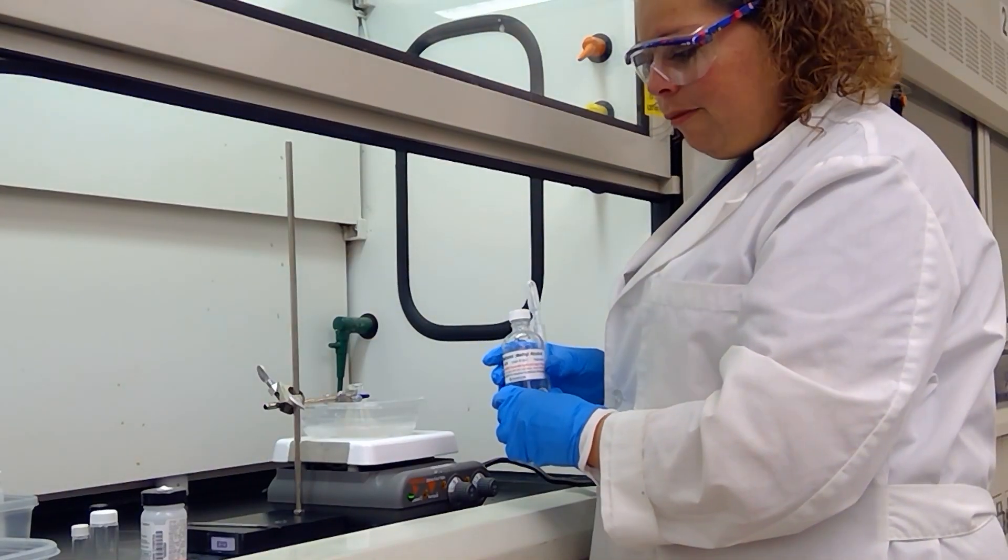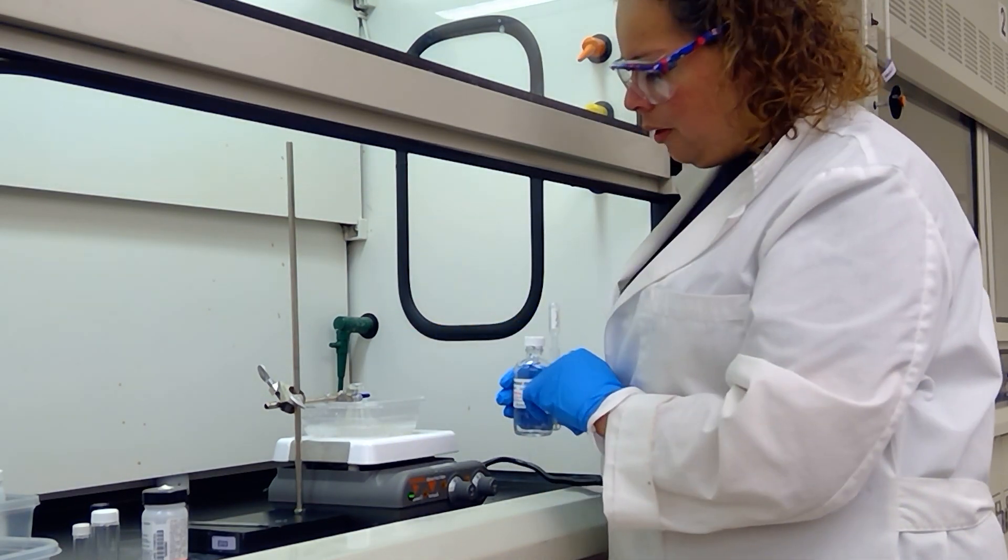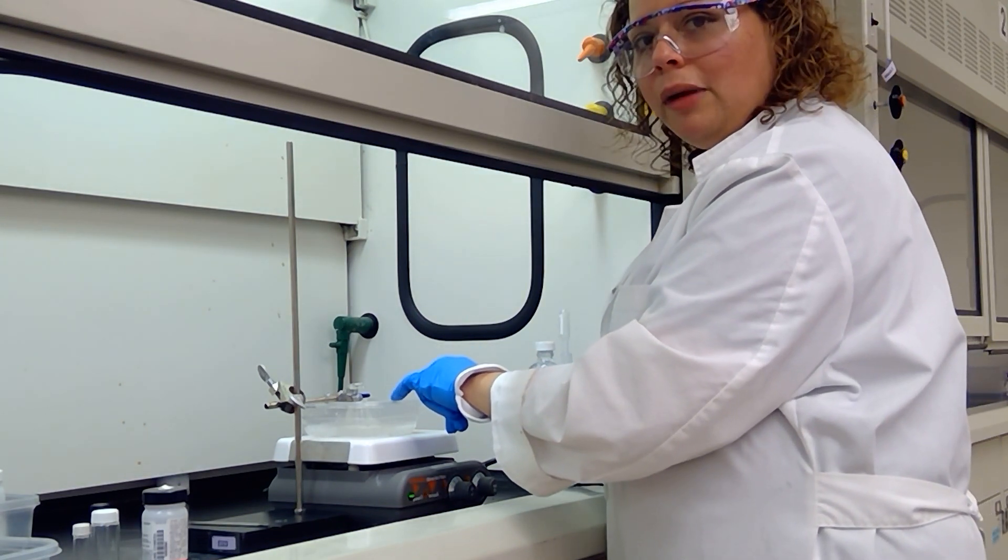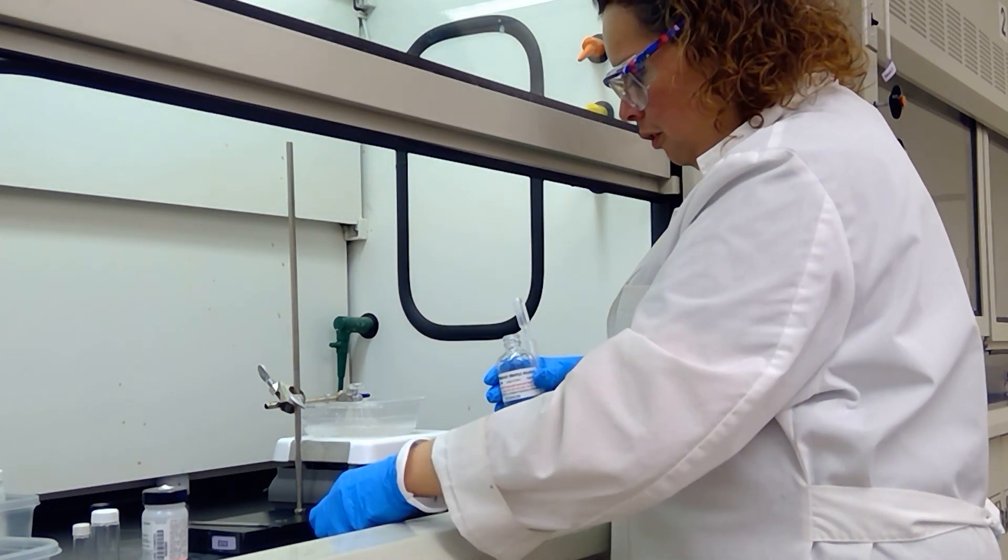I have measured out both my solid compounds. I have my benzophenone in my 25 milliliter Erlenmeyer flask. I have placed it in a small tray with some ice water and I'm going to add five milliliters of methanol just to dissolve my solid.